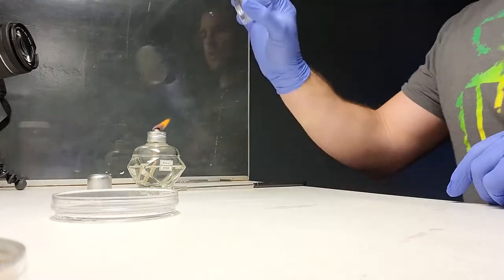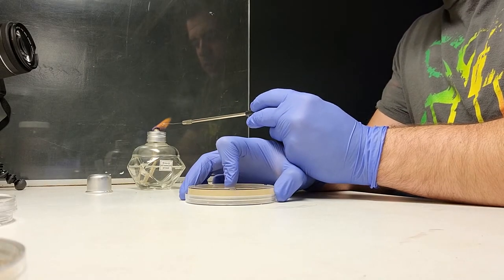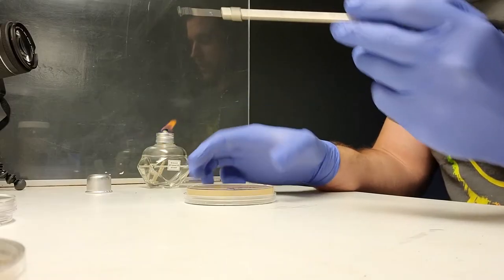I streaked around this side, and now I'm going to streak for isolation. I have an inoculating loop — this is used in bacteriology; I used to work as a microbiologist. It glows a brilliant red when flamed, it's really thin so it heats up really quickly and cools really quickly too.